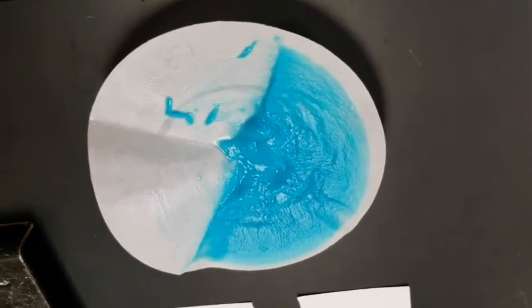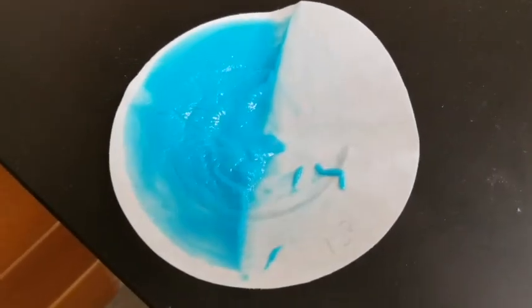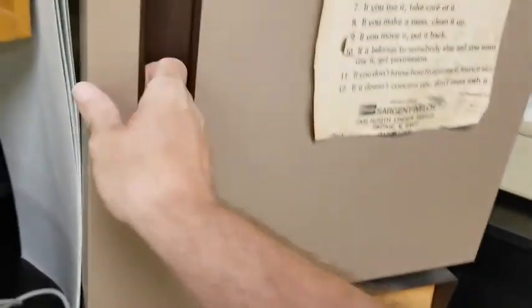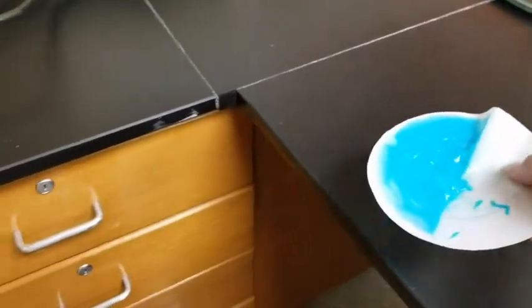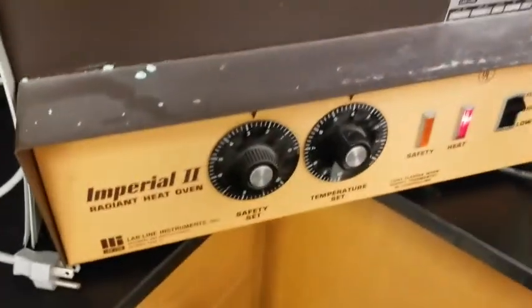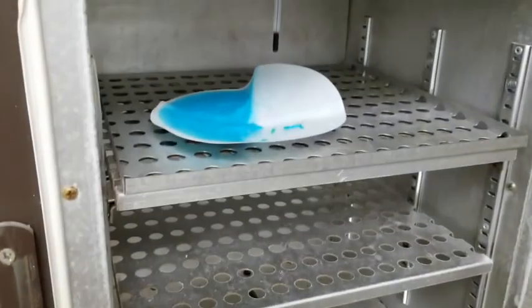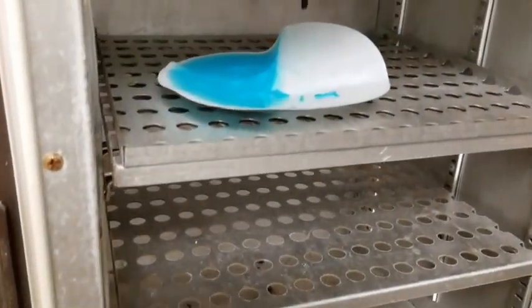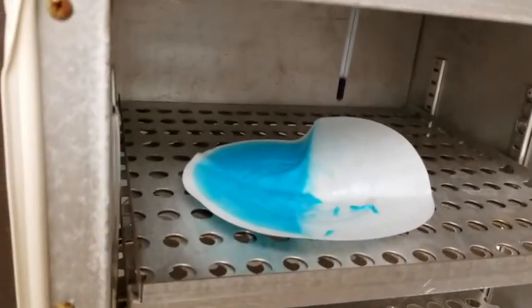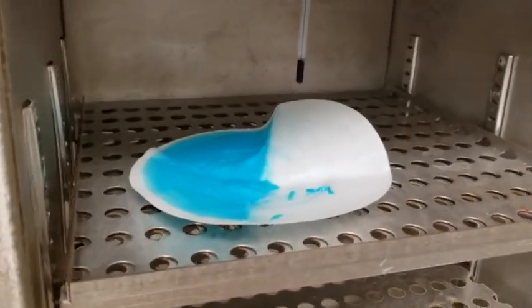Because it will be exposed to more air. Of course, an even better way to help it along is by cooking it a little bit. So we've got an oven here that we've got on low. We're going to open this up, take our wet precipitate, and put it in there, and this is just going to gently heat the water off. We don't want to burn it, we don't want to roast it, we don't want to actually cook it. All we want to do is heat it up to accelerate the water removal process.